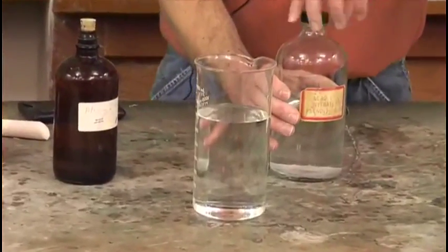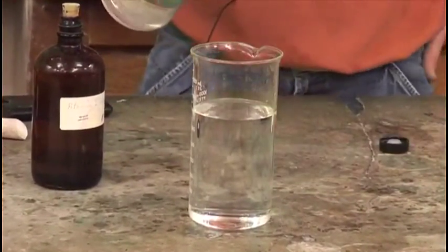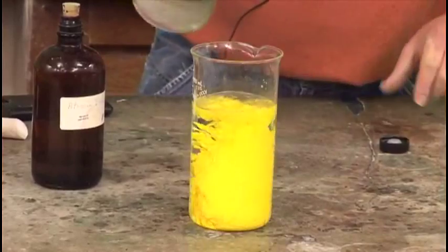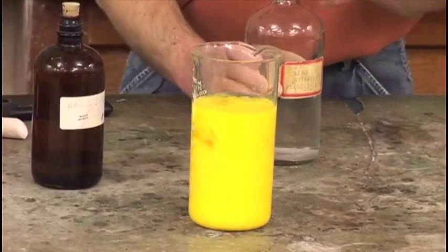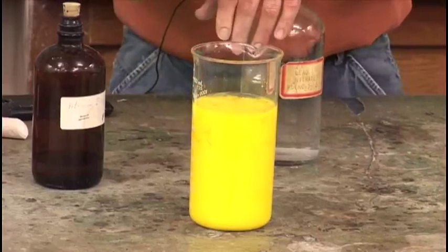Some light will go ahead and make it change over time, so we put it in a tinted bottle. I just put a little bit of that in, and watch this—this is a nice reaction. We form a solid precipitate, a yellow solid is formed.